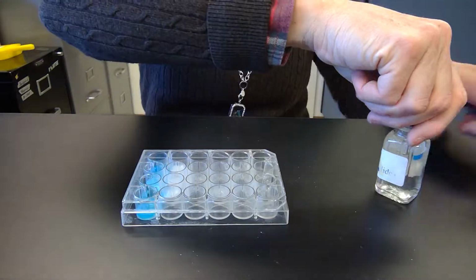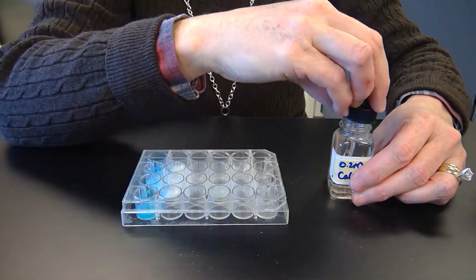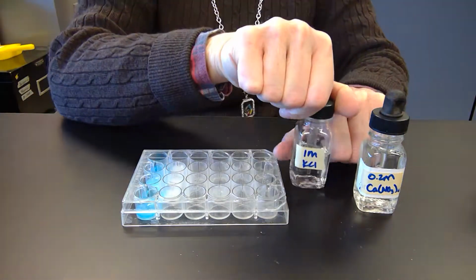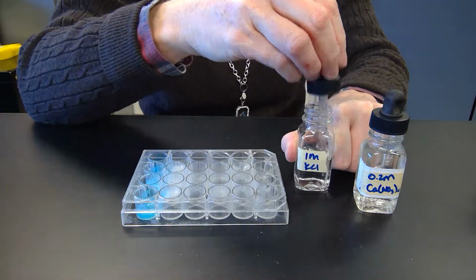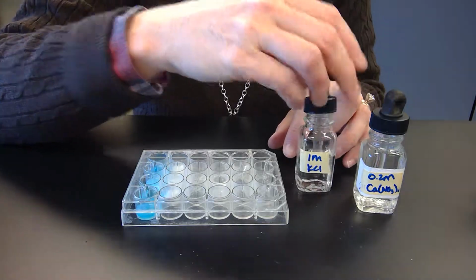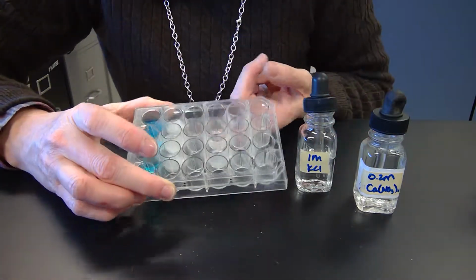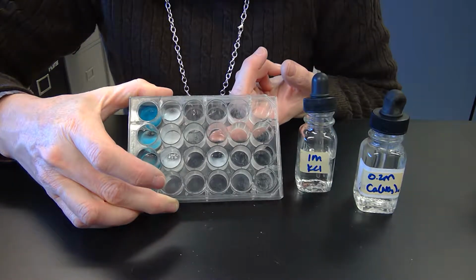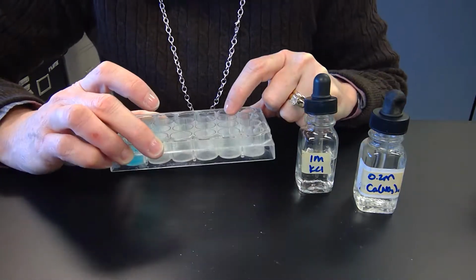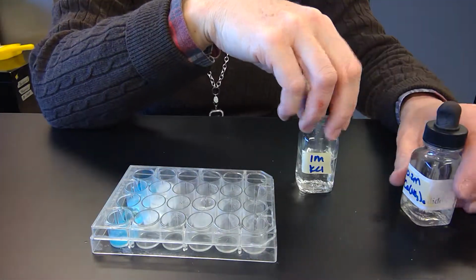And then the next one is calcium nitrate again, just clear. We're going to add potassium chloride, so we'll add that in. And that didn't give me anything. It's this one underneath my finger. Kind of hard to see, but it's just clear. I'm going to let that sit and look at it in a second maybe.